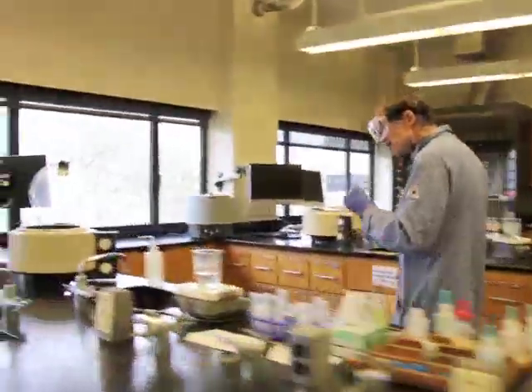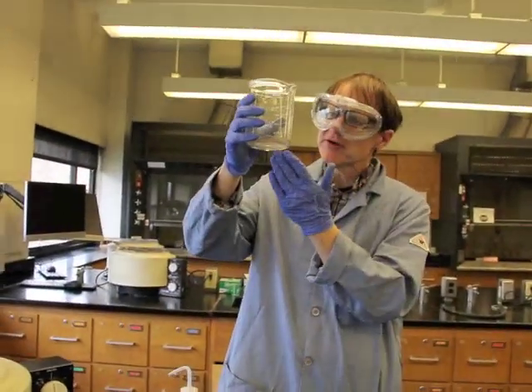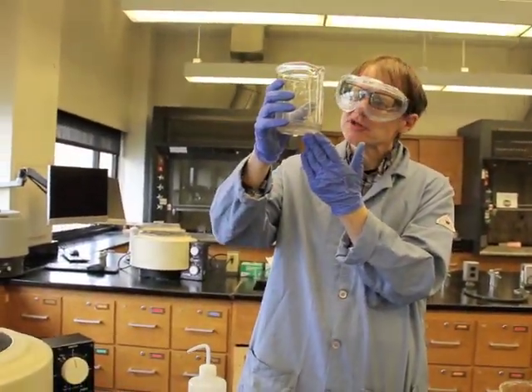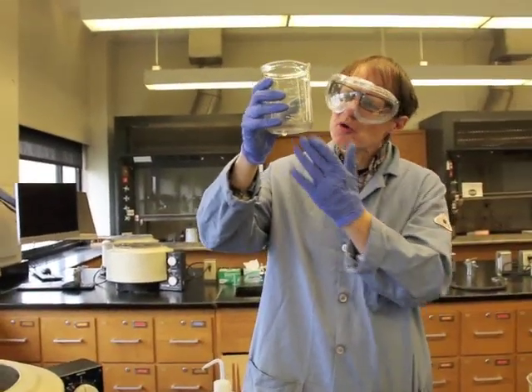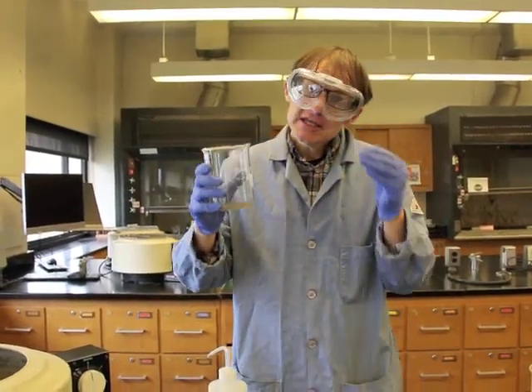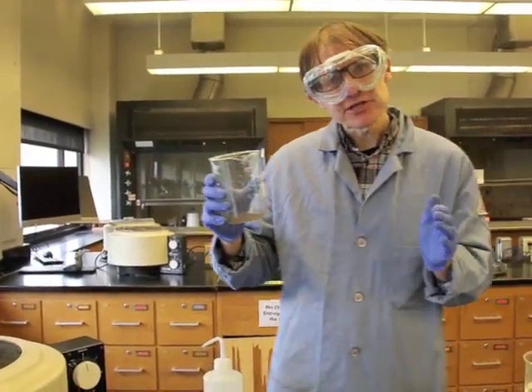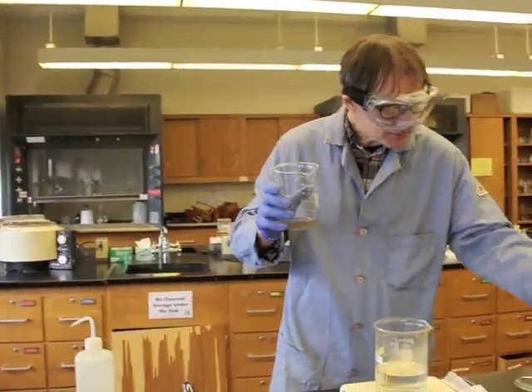we also want to be careful about how we deal with the solutions that we've worked with. We've been working with copper, silver, bismuth, ammonium, hydrochloric acid, sodium hydroxide. What do we do with those sorts of materials? In the old days, we would have just rinsed them right down the drain. But over time, we've come to realize that it's more important to deal with them more safely.